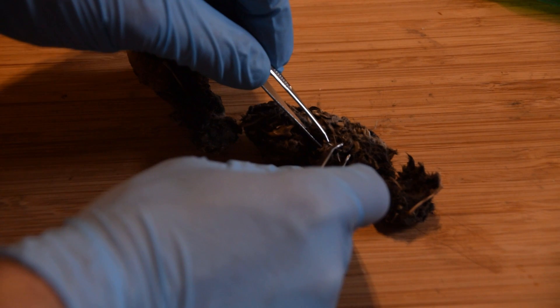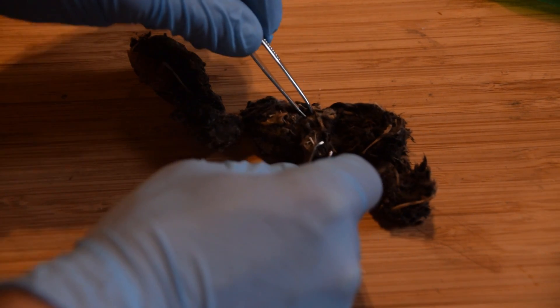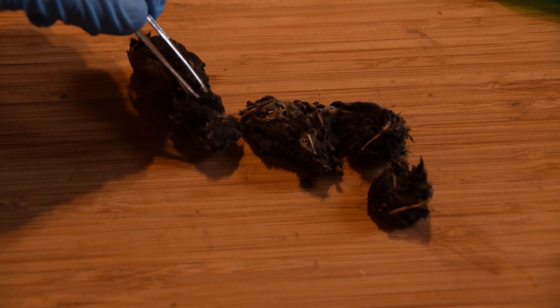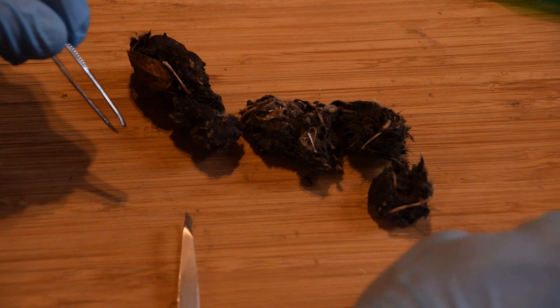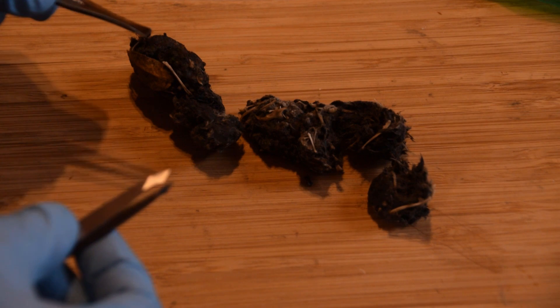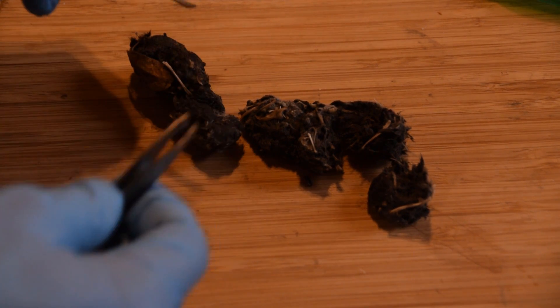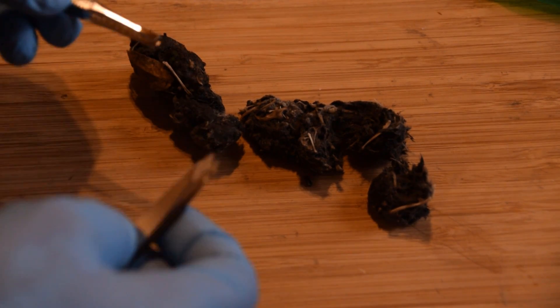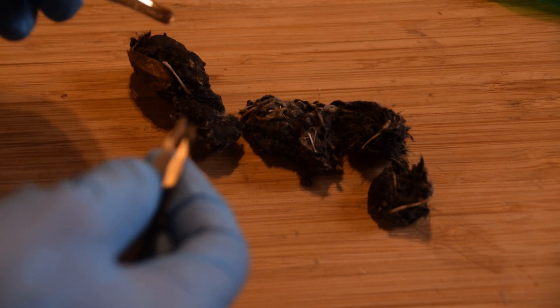It's extremely moist as I pull it apart. There's one little bug — I'm imagining there's probably going to be several little bugs inside of this. That's okay, I'm going to try to catch them as they come out. Again, this is definitely not the proper method, but I thought you guys might enjoy it and I'm definitely going to enjoy it too.